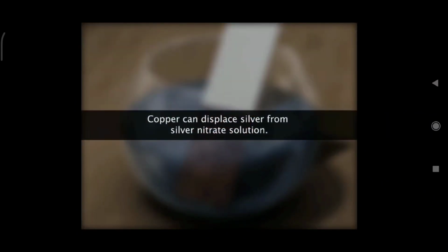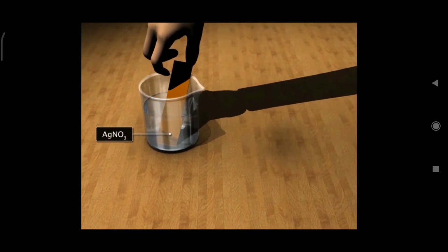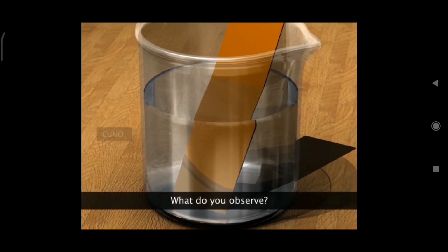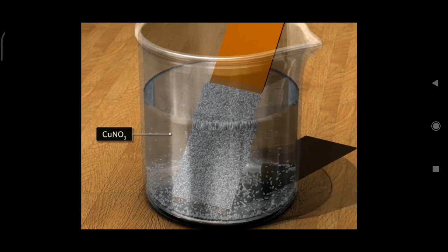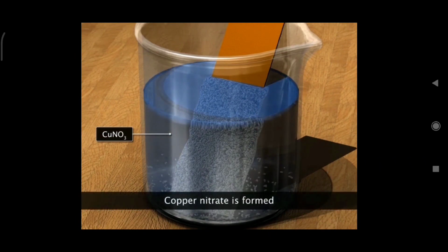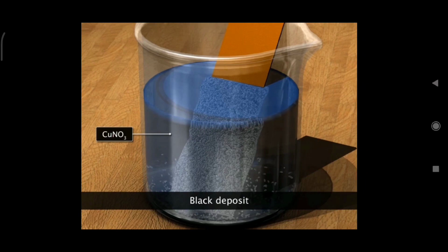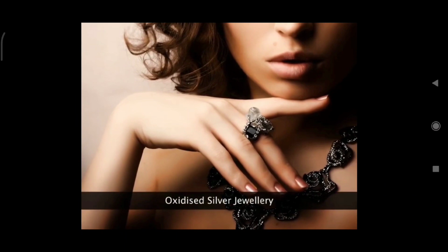Similarly, black silver deposits are obtained when a copper rod is dipped in silver nitrate solution. Copper plate is placed in silver nitrate solution. What do you observe? The colorless solution turns blue due to the formation of copper nitrate. There is a black deposit noticed at the bottom. Freshly formed silver undergoes oxidation rapidly and gives a black deposit. This principle is used in oxidized silver jewelry.